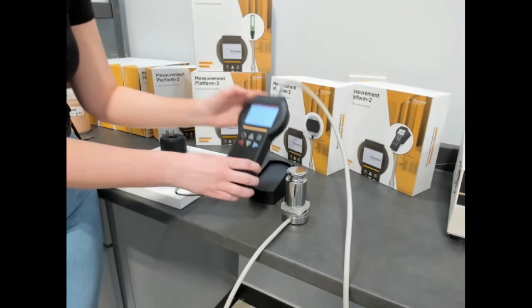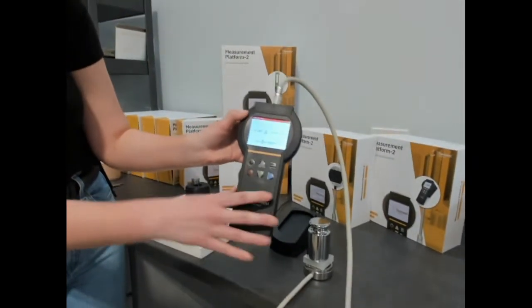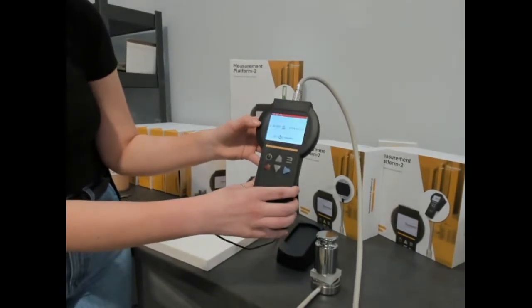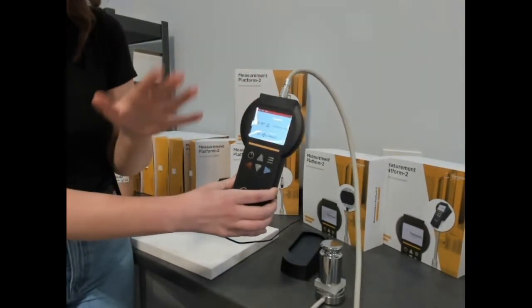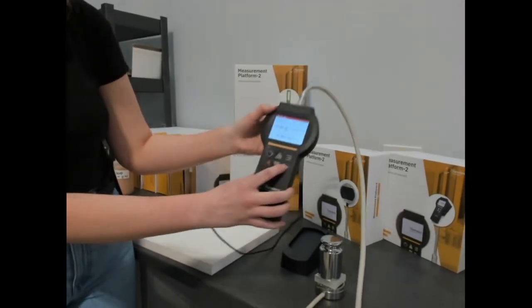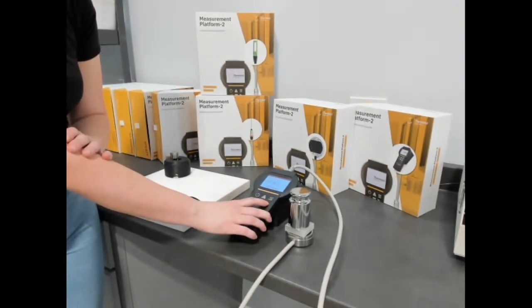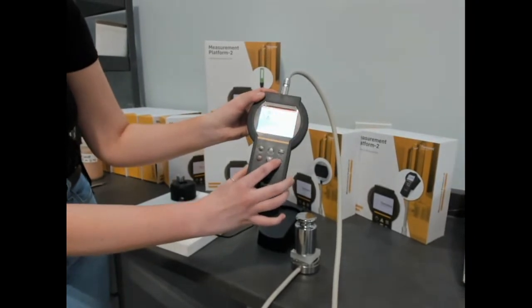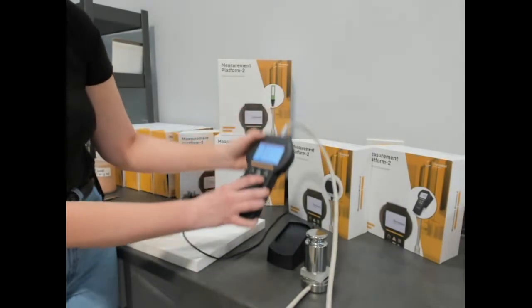On the MP2, if we wanted to run a single measurement — we've already run some for this demonstration — the results appear on the screen here. We can see polypropylene has a thermal conductivity around 0.28 to 0.29. To run a single measurement, you would set the instrument down first and then press and hold the blue arrow, or you could scroll through and set up an automated schedule from the MP2 itself. Since we've already run some measurements today, we're not going to perform that again.